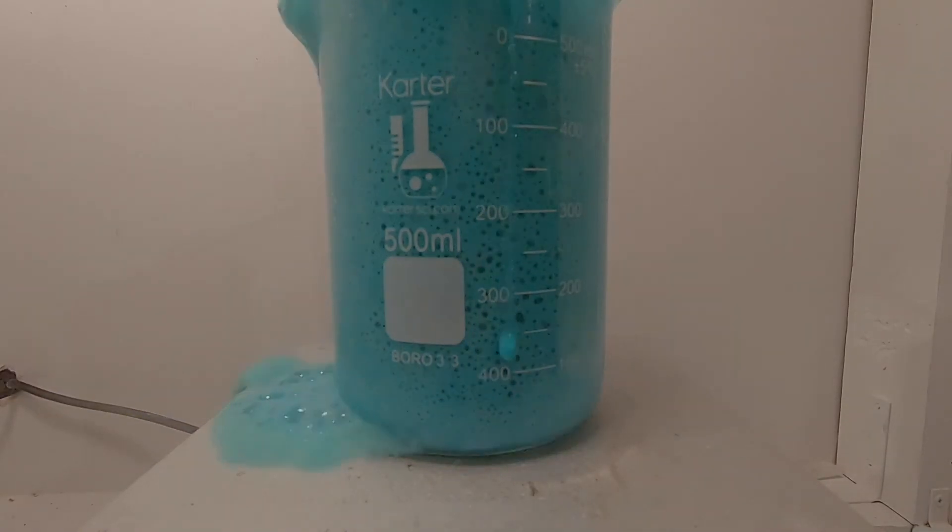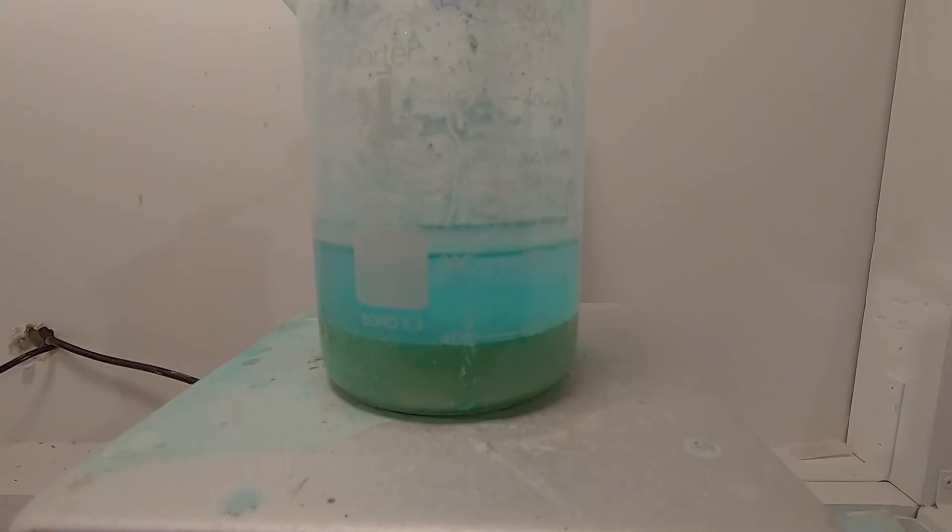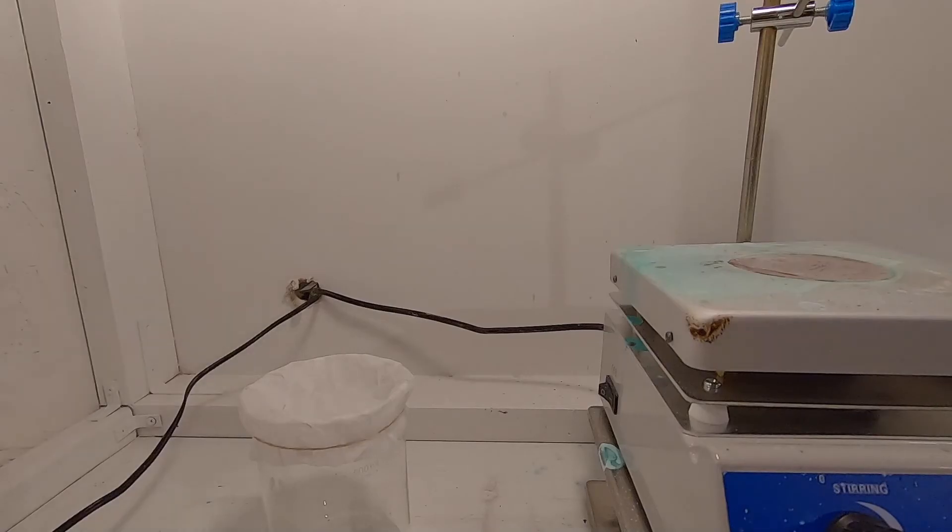Another byproduct will be sodium sulfate, but this will rinse out with plenty of water.